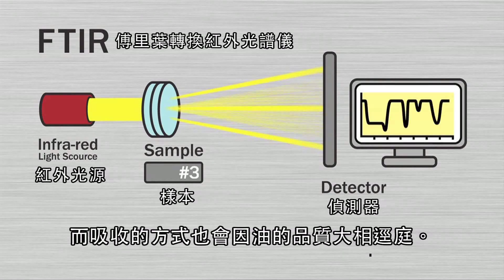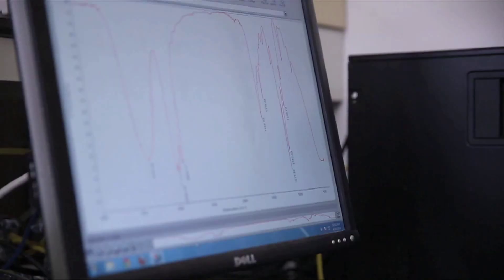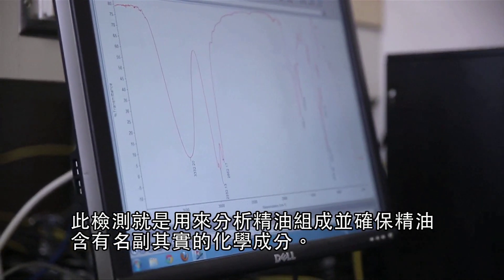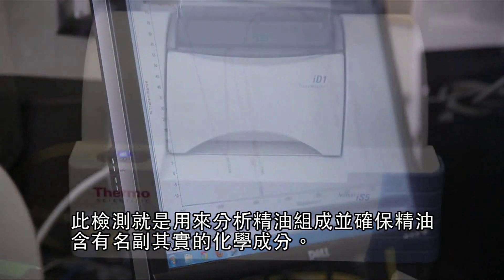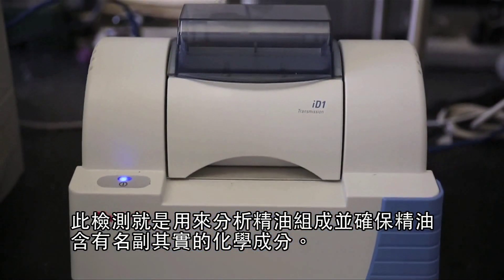The pattern can also vary depending on the quality of the oil. This test is used to analyze the composition of an essential oil and ensure that it contains proper chemistry.